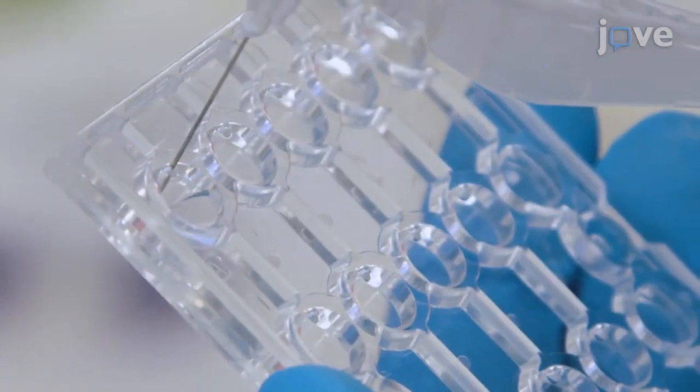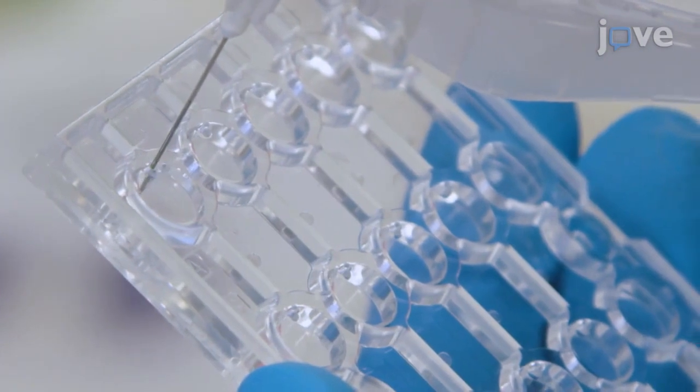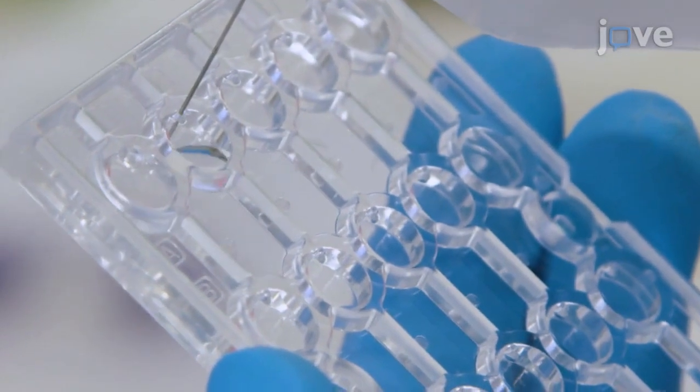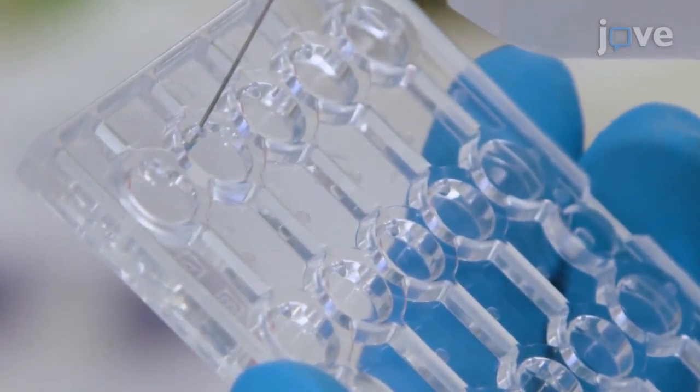Holding the device with the port facing upwards, slowly inject each concentration of the substance into each of the five wells of one row of the device surface, until a small droplet appears on top of each port.